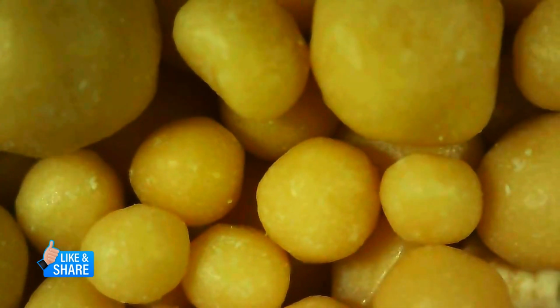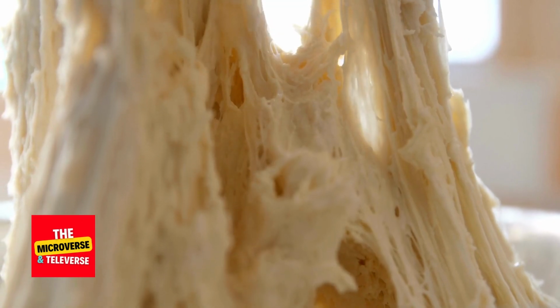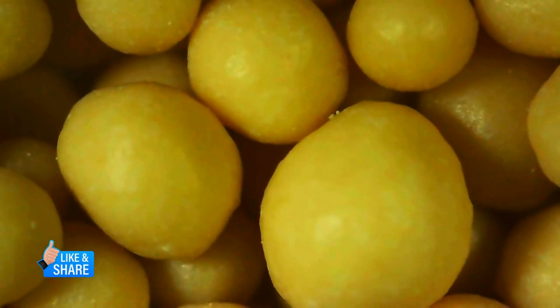From its tiny particles to its significant role in baking and fermentation, SAF yeast offers insights into the world of culinary science. Thank you for joining us on this microscopic journey.